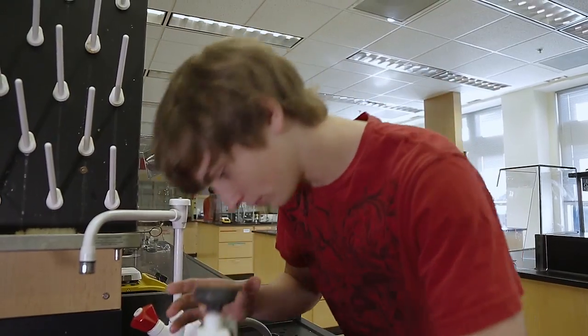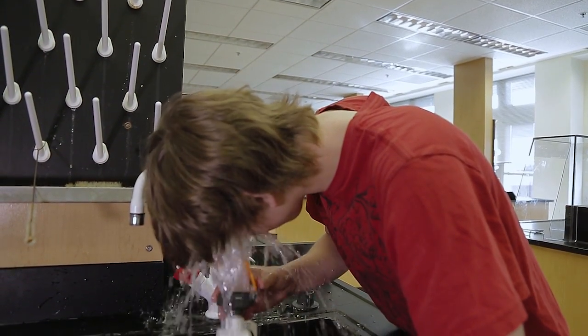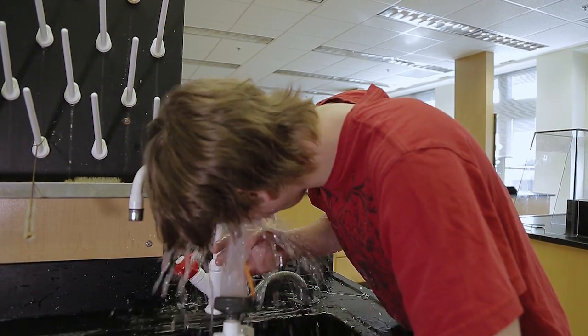To use the eye soaker, simply hold the spring-loaded handle and water will start coming out. You do not need to turn the water on at the sink.